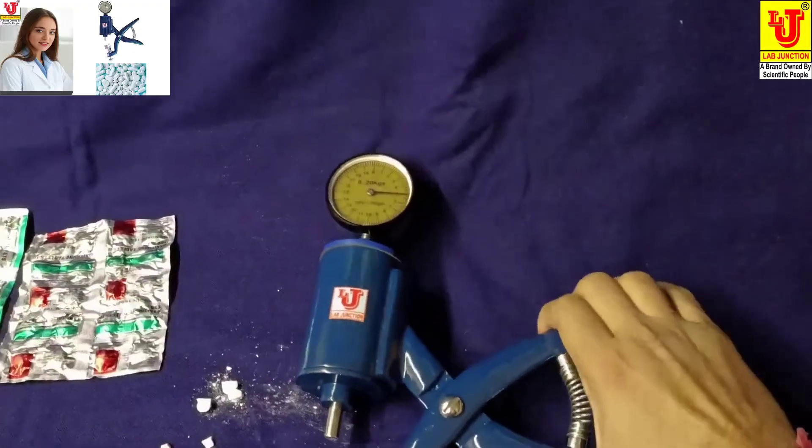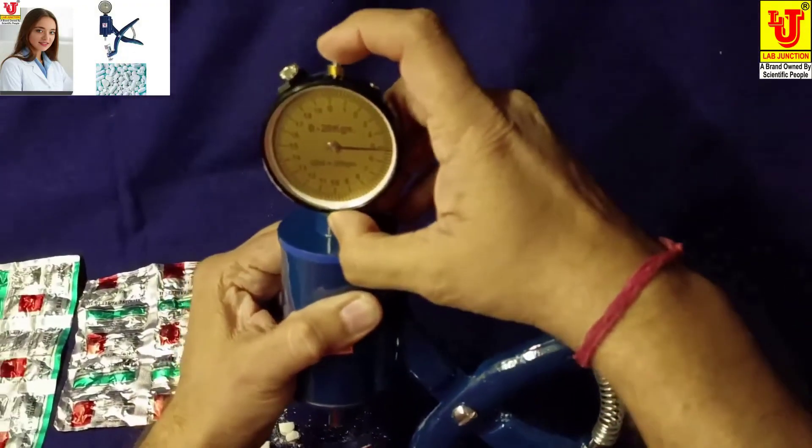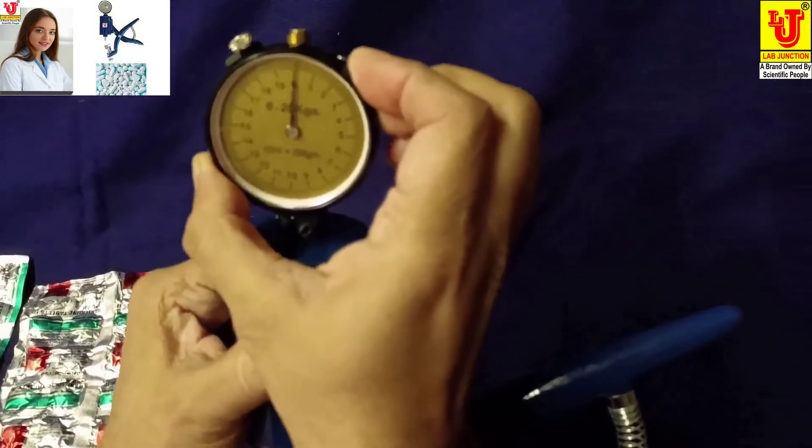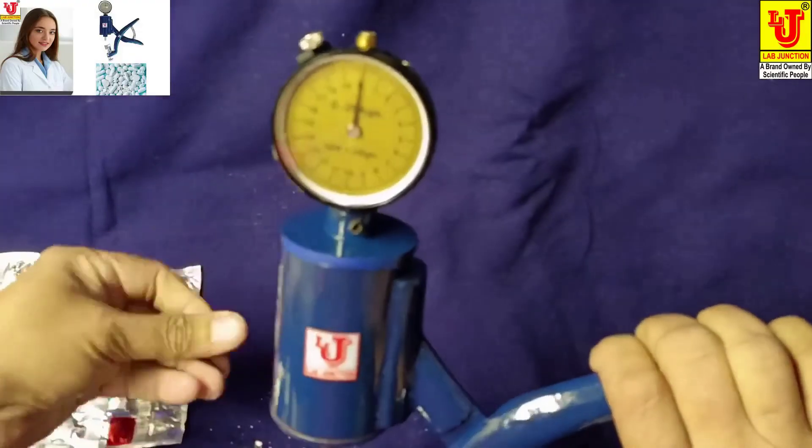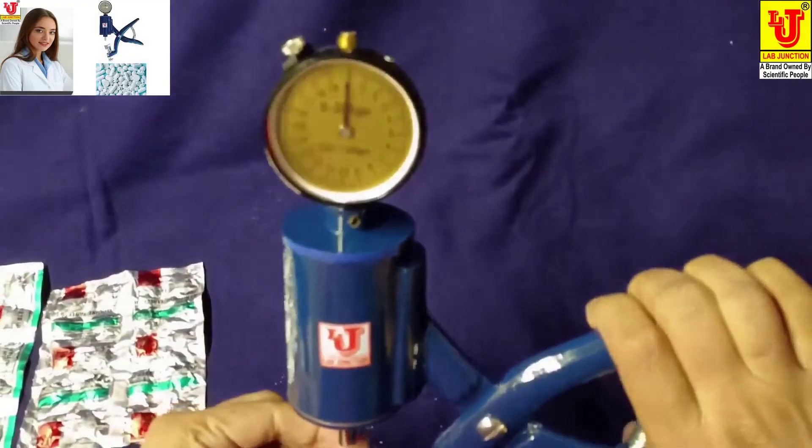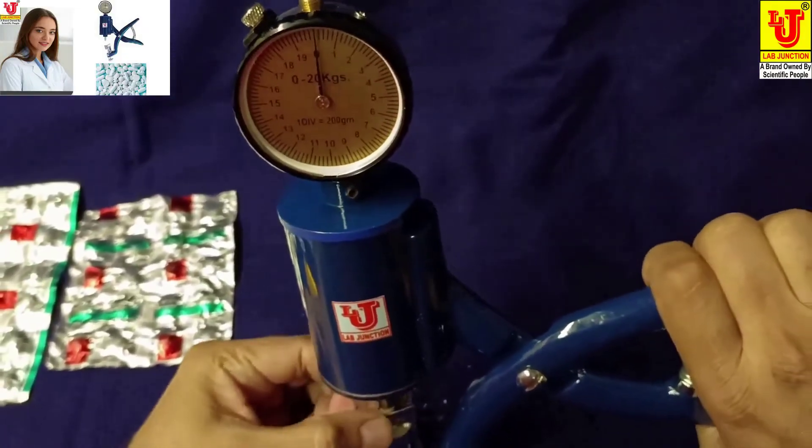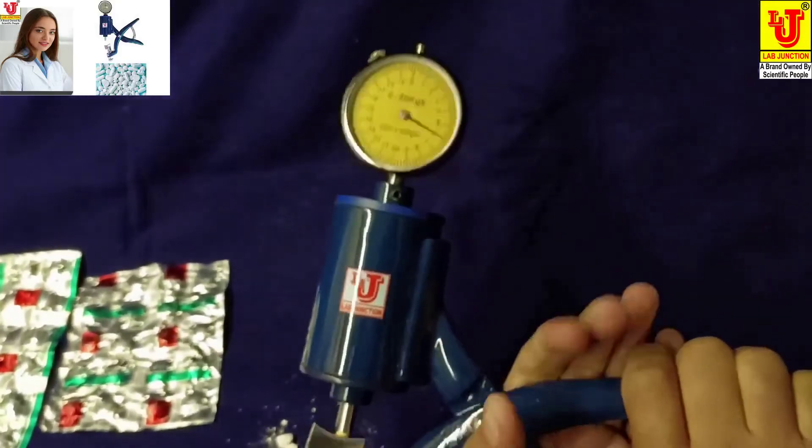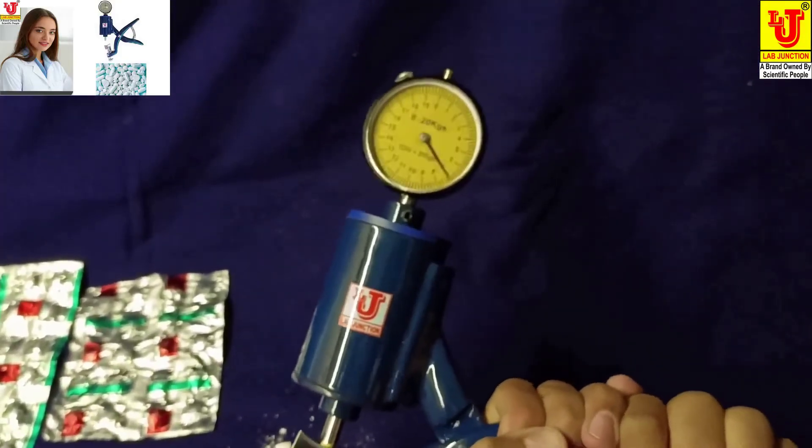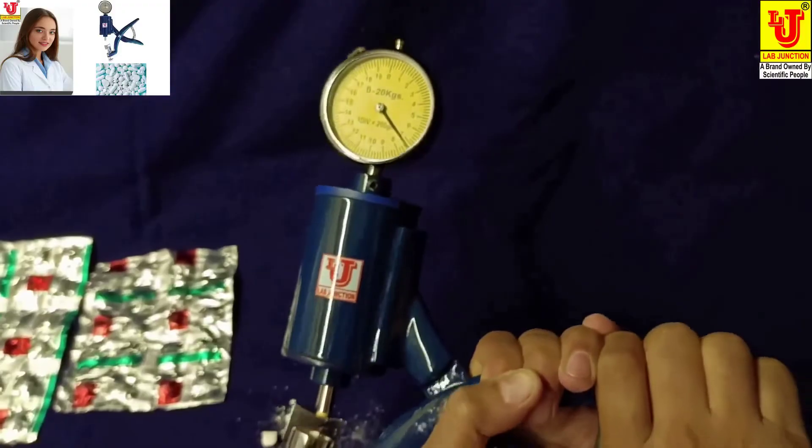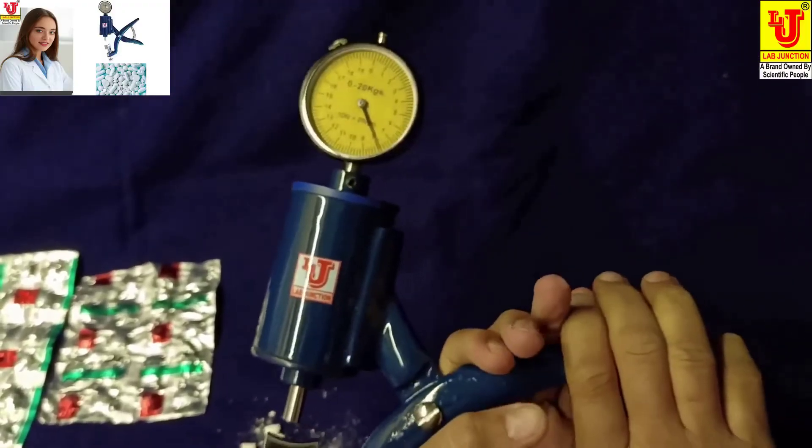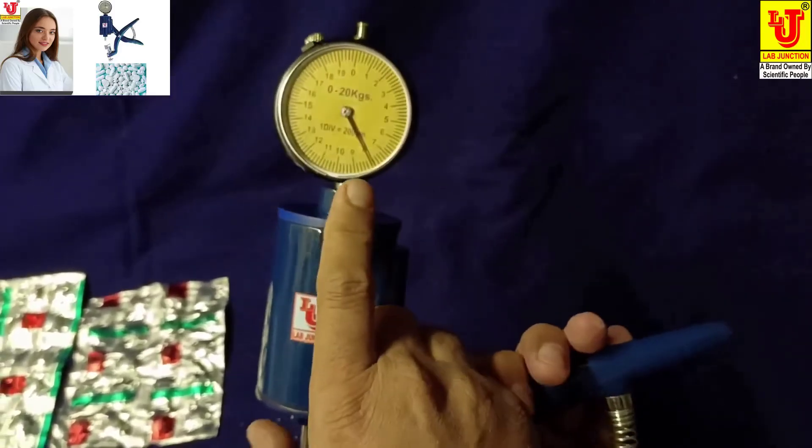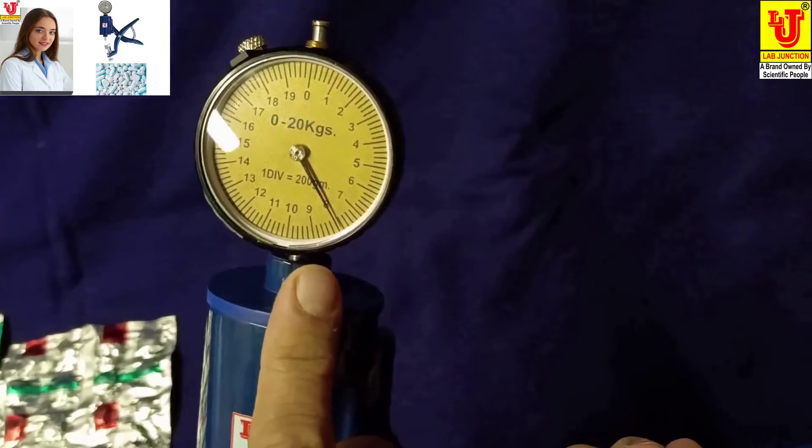I have one more tablet. Again setting zero like this, taking another sample of the same tablet. Apply force - this tablet breaks at 8 kg force.